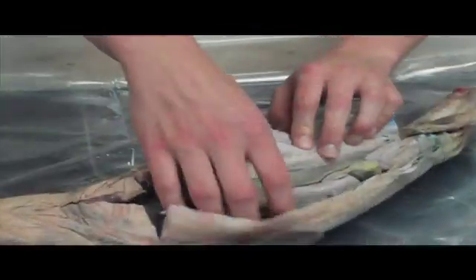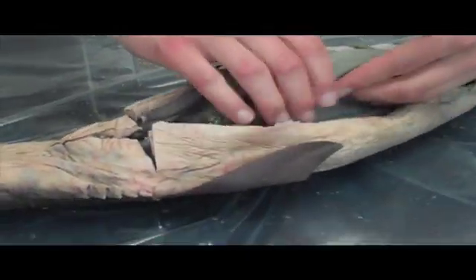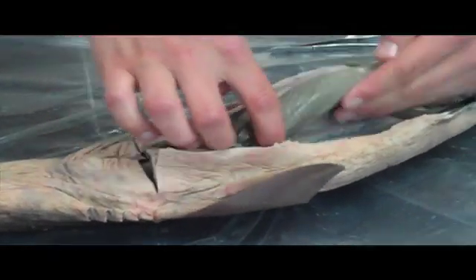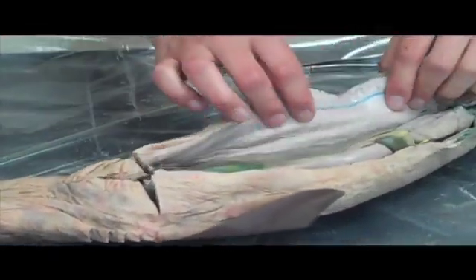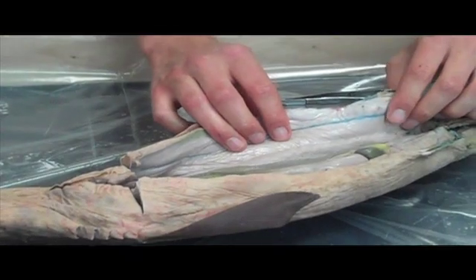A nice big liver, right in here. Based on the video we watched, why does it have such a huge liver? Doesn't it use the liver for... Buoyancy. Yeah.